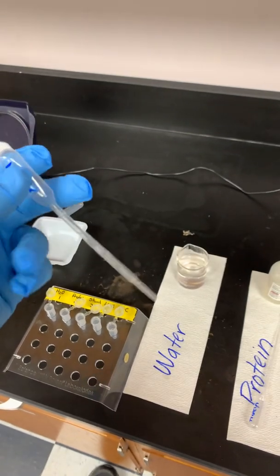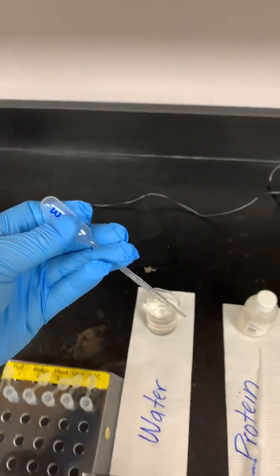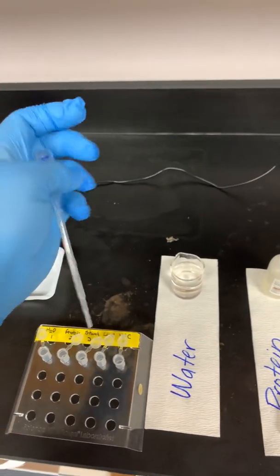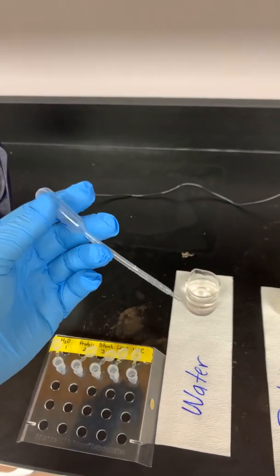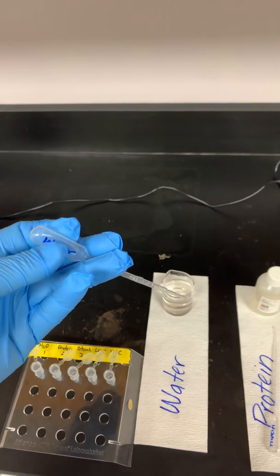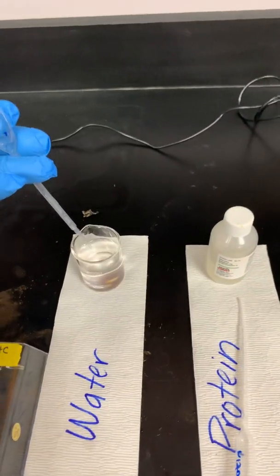You can do it like this, but this gives you a lot more control. Again, make sure it's seated firmly, and then you're going to expel all of the air out. So to do that, I'm just going to squeeze it. I don't have to grip it all like this to get it all out. Again, I just need to get most of that air out. So solid grip on it, squeeze the air out. You need to do that before you go down in the liquid you want to transfer.